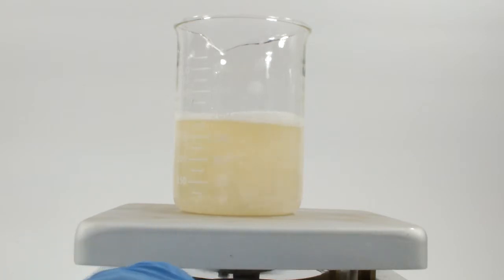After just a few moments of stirring, it does start to thicken and it will seize up, as I said. A big heavy stir bar does help with this, but it's completely inadequate once it starts to gel. This is why either an overhead stirrer would be better, or probably just a glass stirring rod.